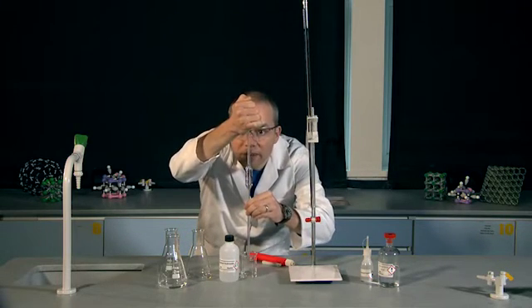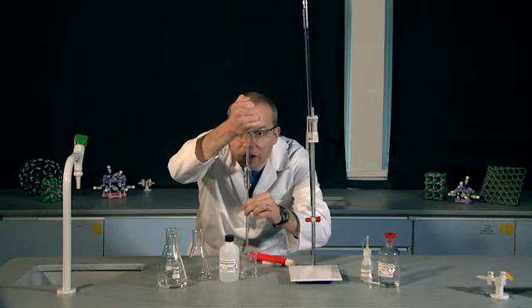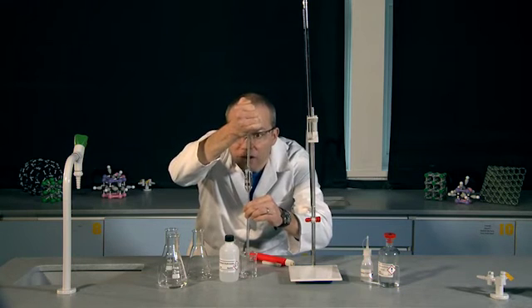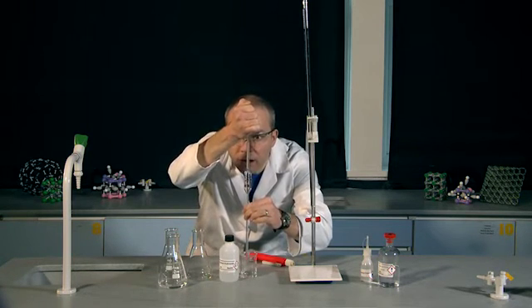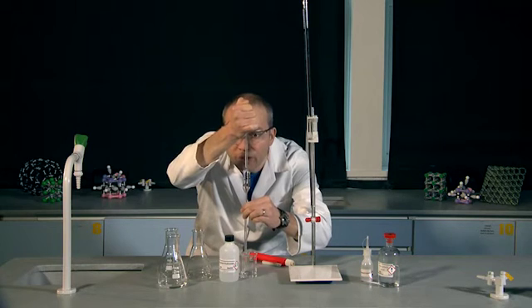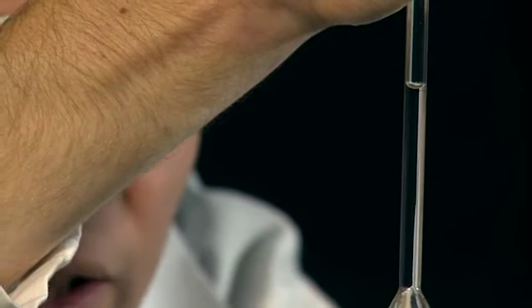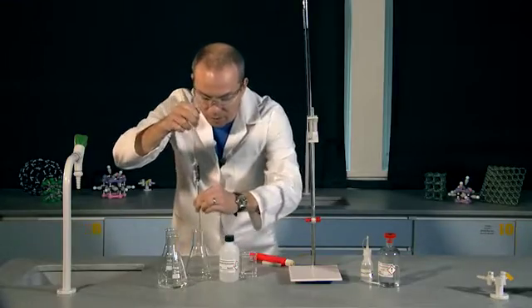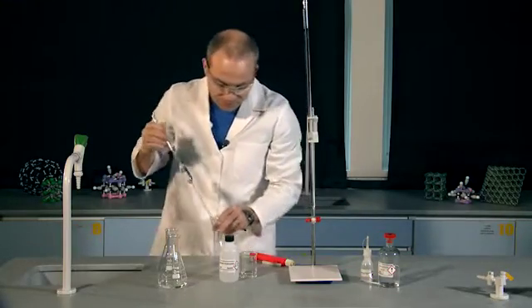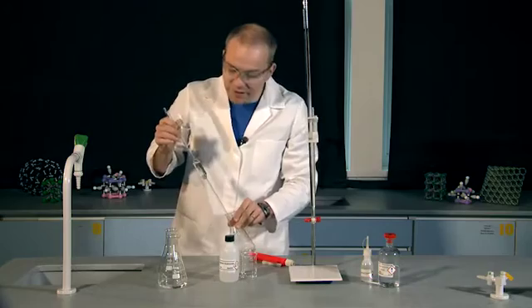What I'm looking for is the base of the meniscus, the curve at the top of this solution, to be sitting exactly on the mark. Then I know I've got a very accurate measure of 25 centimetres cubed. So, into my conical flask. I'll just let this drain.